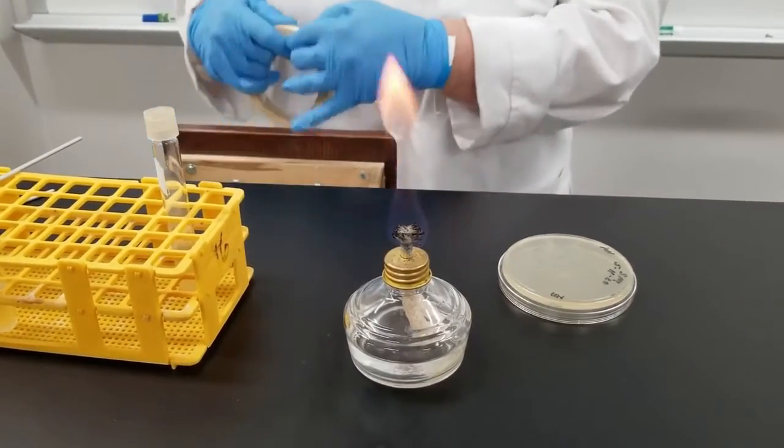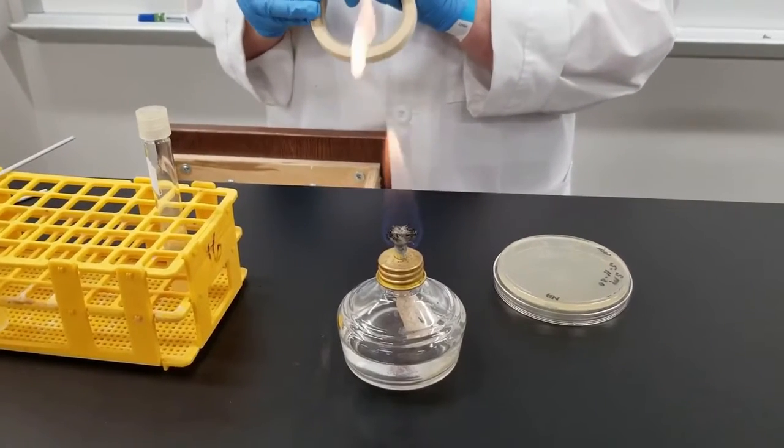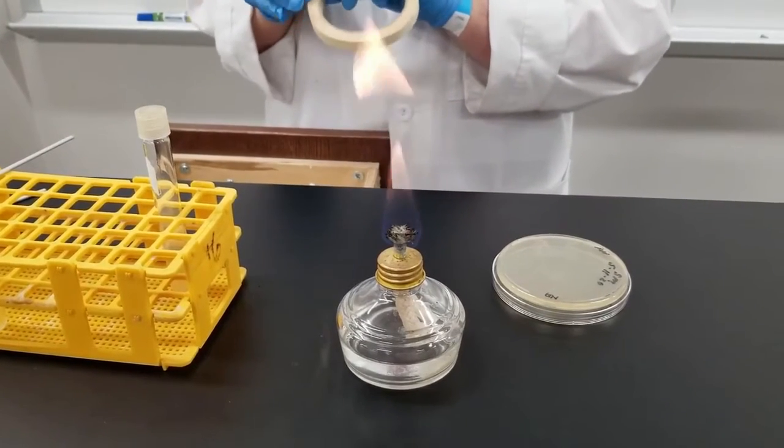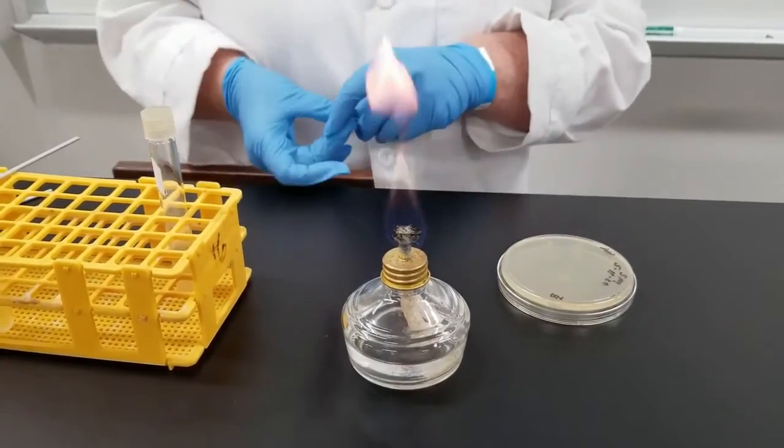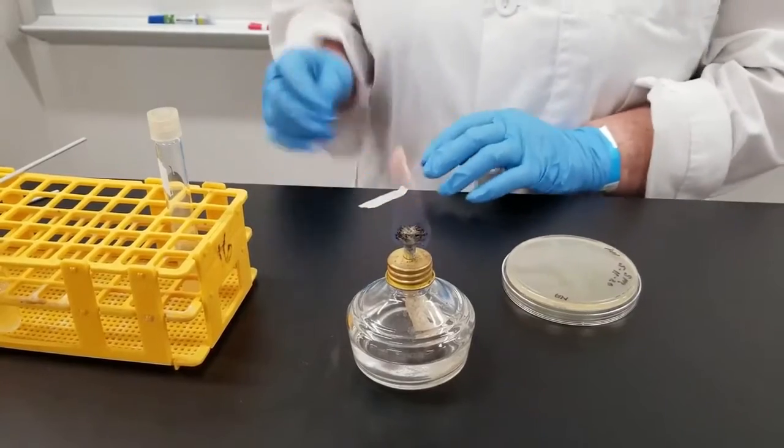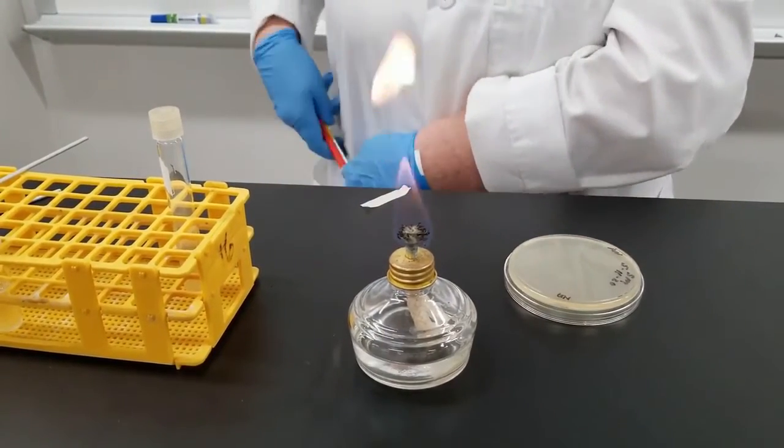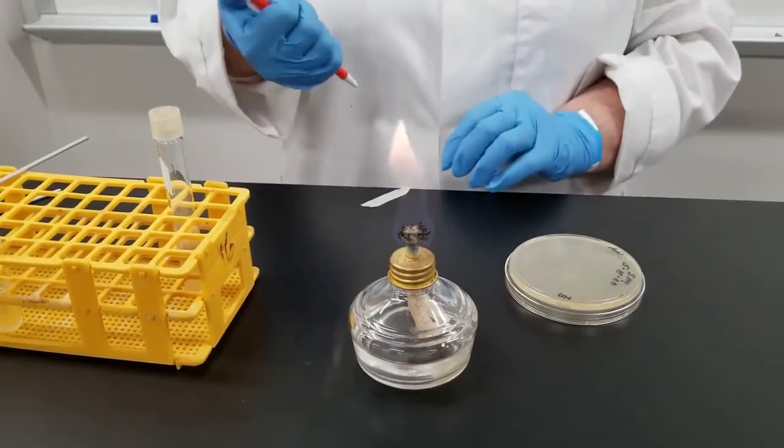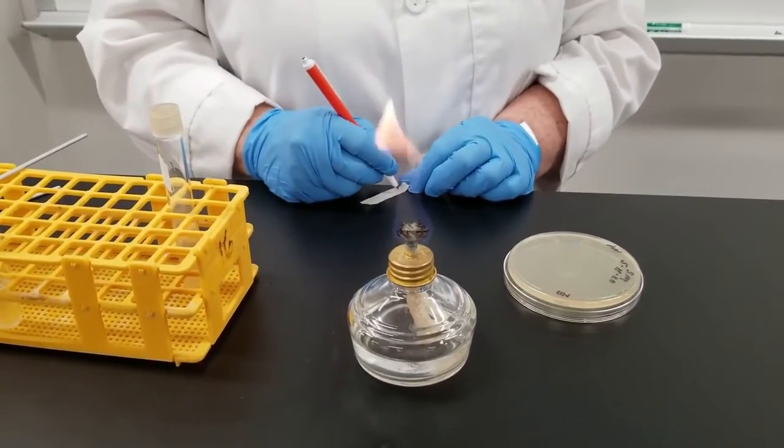These will be incubated at room temperature. Sometimes you'll incubate at 37 degrees, sometimes at room temperature. It just depends on what you are doing. For this particular exercise, I do want to go at room temperature, and we will go for 24 hours. Sometimes you may need to go for 48 hours. Once again, it depends on what test you are using.